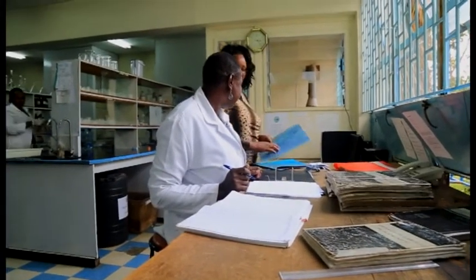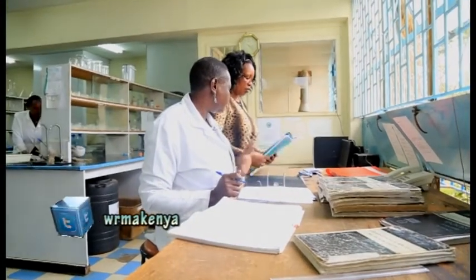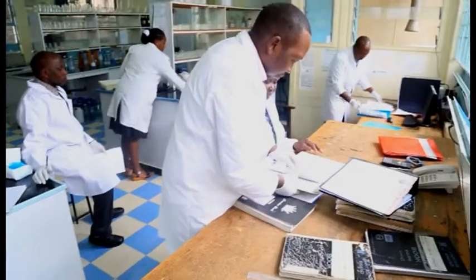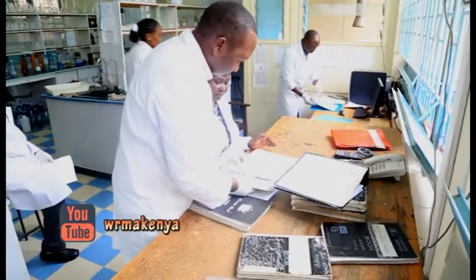officer in charge of the lab to confirm if her typing is right. Then if her typing is right, the officer signs as the analyst. Then the report goes back to the head of the lab to do the final signature. Then the report is ready to be released to the customer.